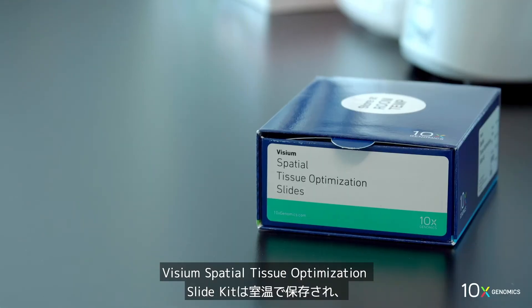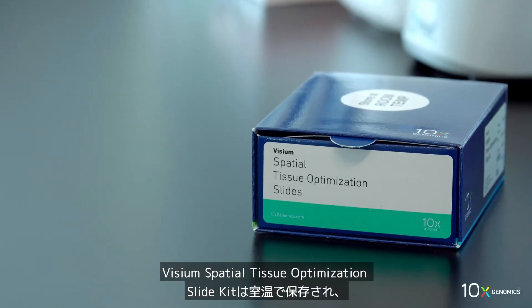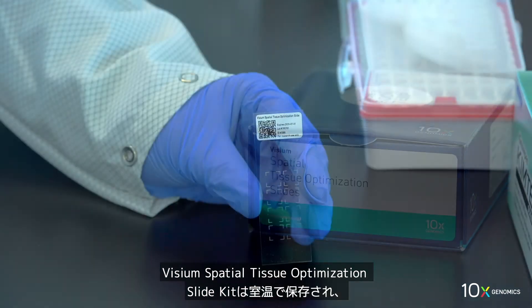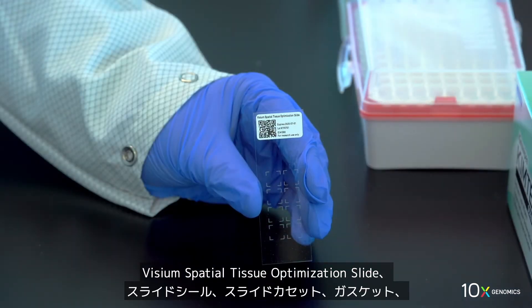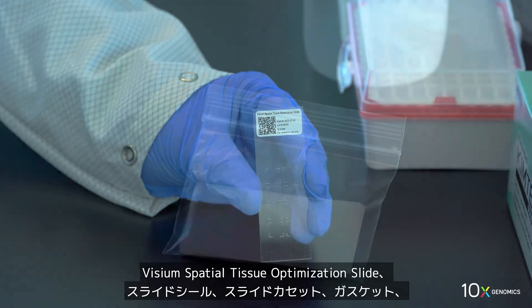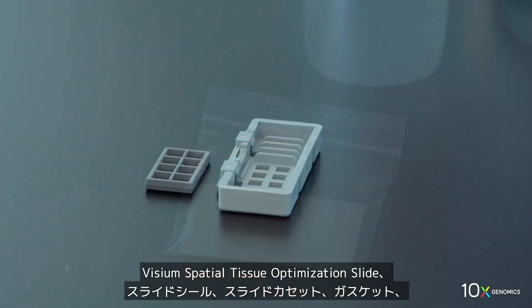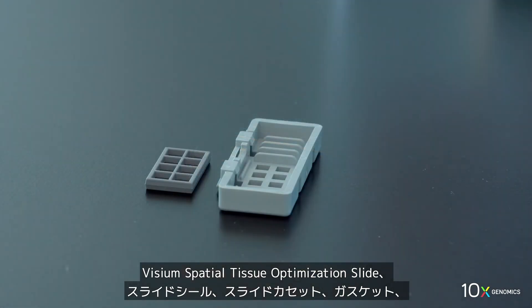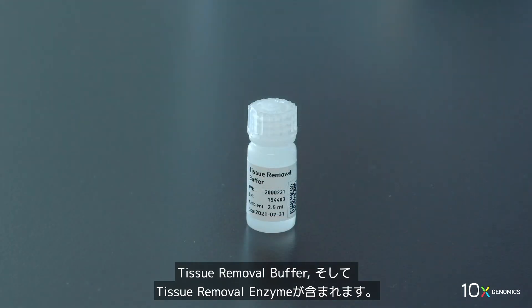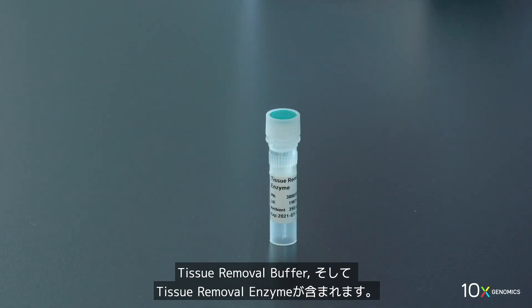The Visium spatial tissue optimization slide kit is stored at ambient temperature and contains Visium spatial tissue optimization slides, slide seals, slide cassettes, gaskets, tissue removal buffer, and tissue removal enzyme.